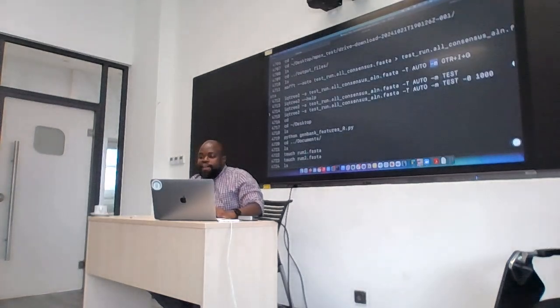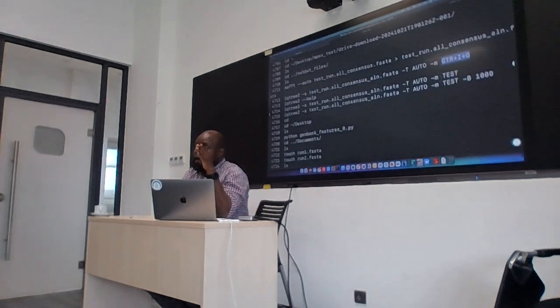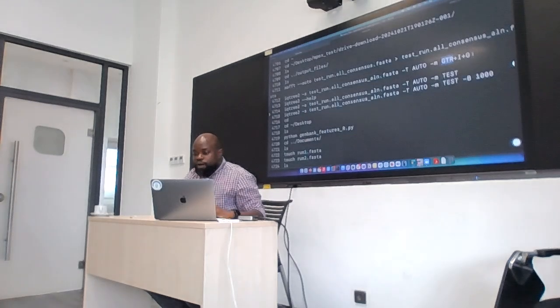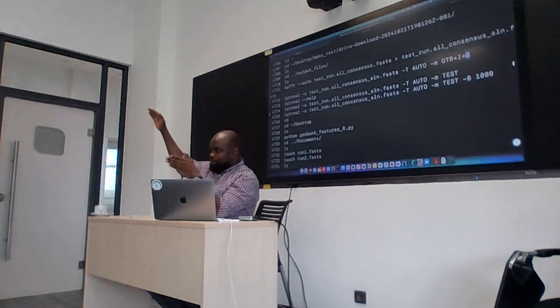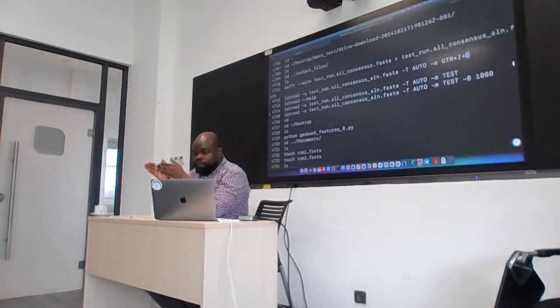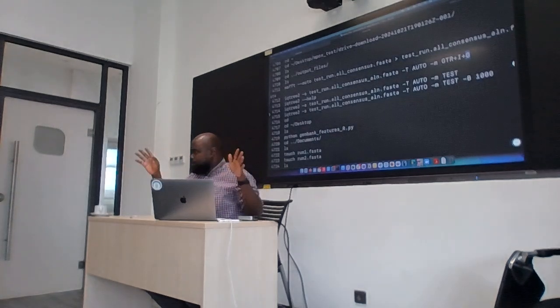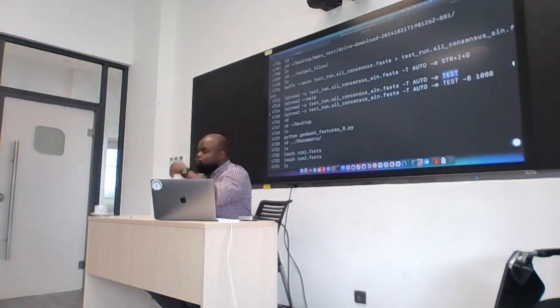In this case, I ran my tree with a very specific model. In my model, I've given it GTR+I+G. What I'm saying here is that I'm letting all the parameters be free. I'm saying that I expect some proportion of my alignment to be invariant, which means those sites are going to be constant. And for the proportion of my alignment that is variable, I expect the rates to vary following a gamma distribution. That is how I've specified my model. The other option is you don't know the model, and you do not want to assume. So we say test. Test, find the best one, use it. Okay?